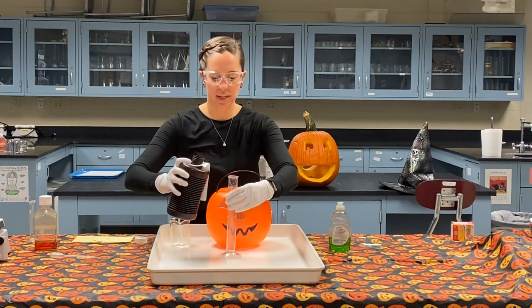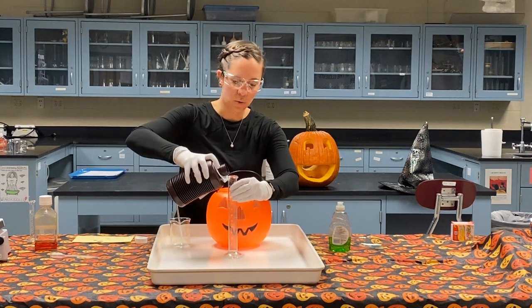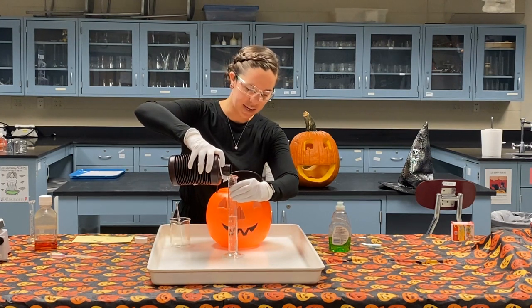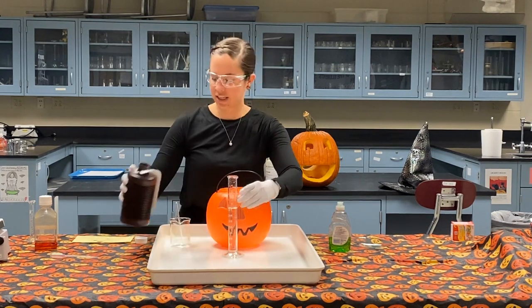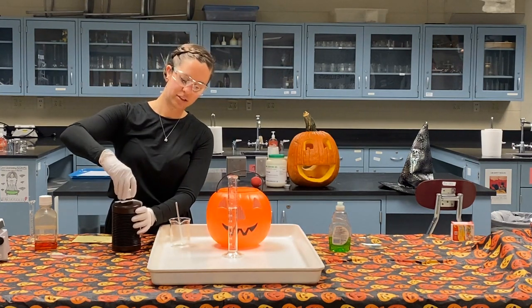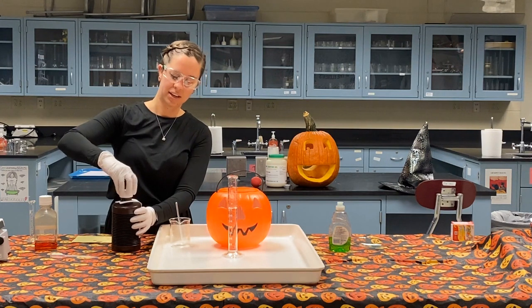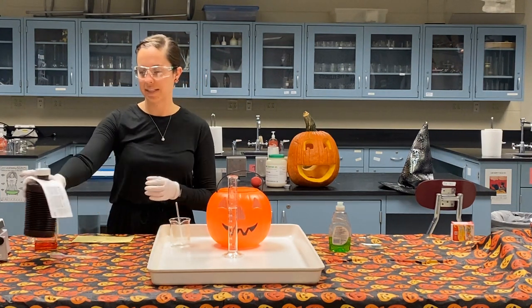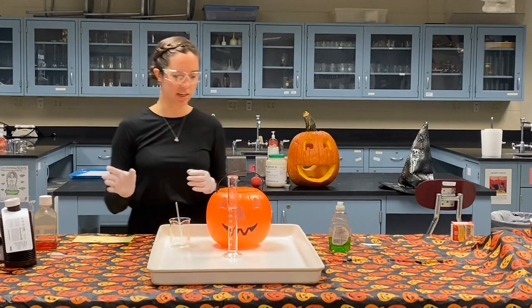It comes in this accordion style bottle because one of the products of the reaction, as you may remember from that first demo you just saw, is a gas. And if we are producing a gas in a sealed bottle that has no room for expansion, then we obviously are going to have a problem, and this could potentially explode. We actually had this happen in the chem stock room a couple of years ago, and it was not good.